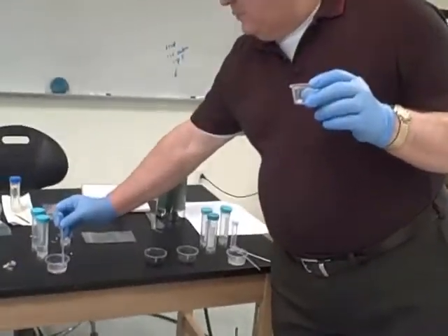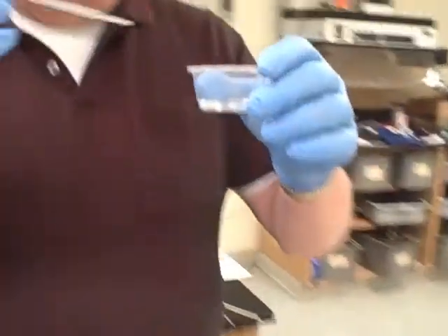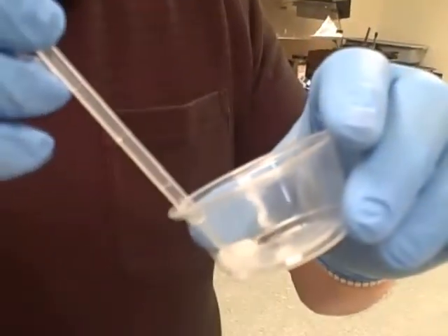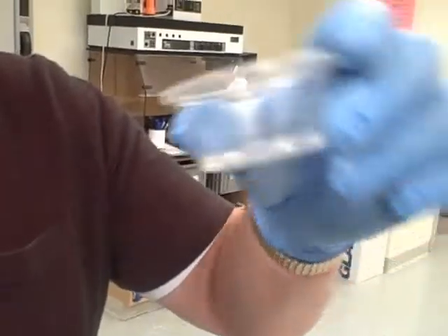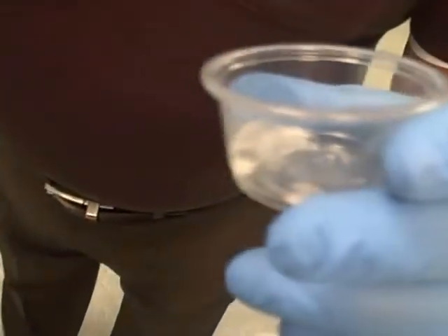As you know, what happens when you add just a little bit of water to calcium metal. That is calcium, isn't it? Nothing's happening. It's supposed to be going crazy. It's fizzing. Now it's going. Okay, there we go. You've got to get the coating off it first. It's got a coating on it.